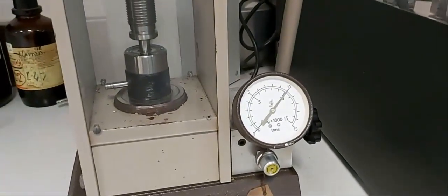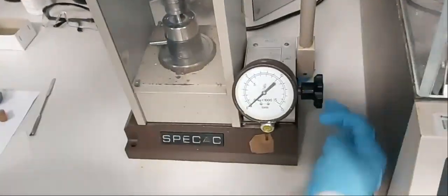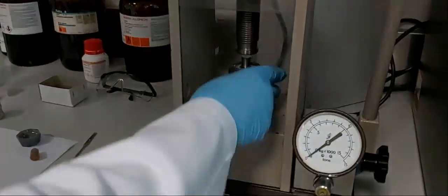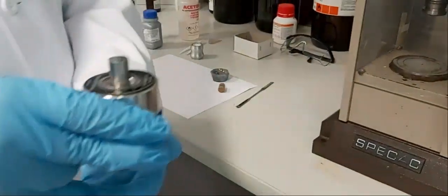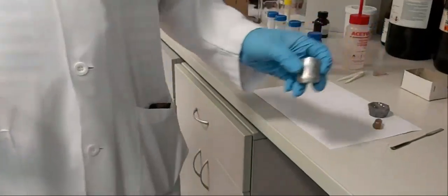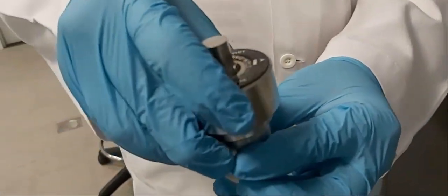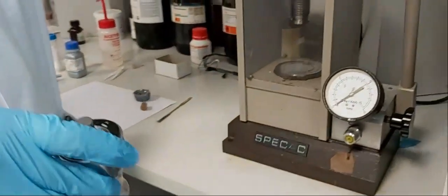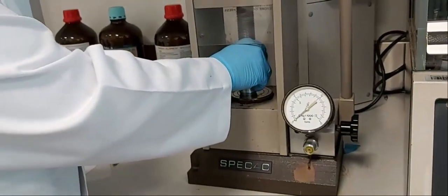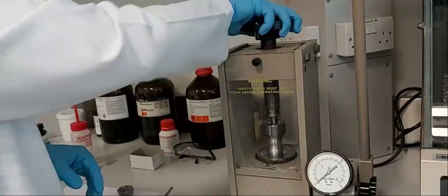We wait a few seconds with the sample inside, then we open the press. We take out the sample and try to remove the fragile disk from the die using the same hand-pressure method. We convert the powder to a small disk this way.